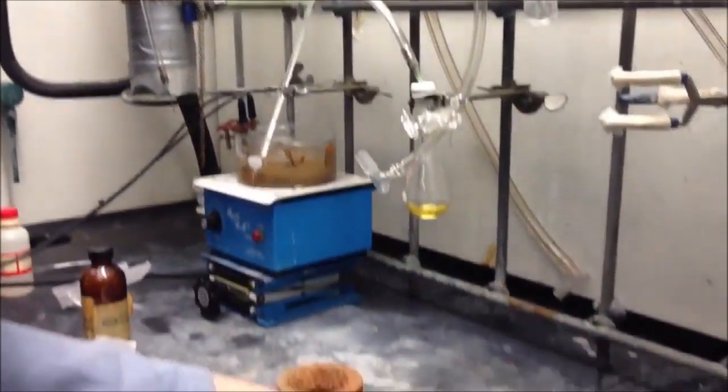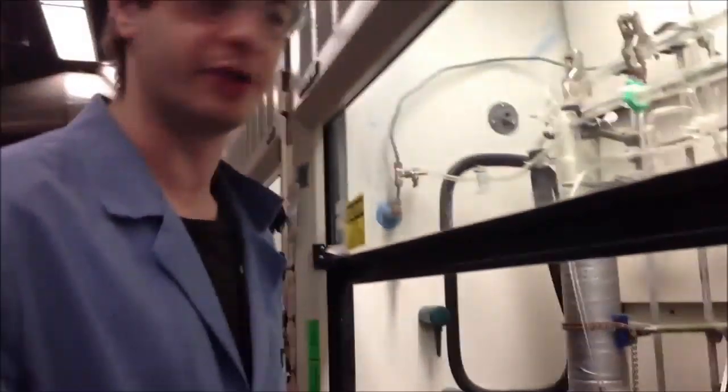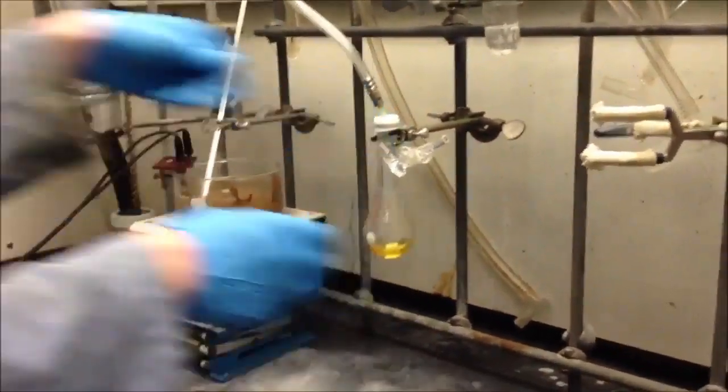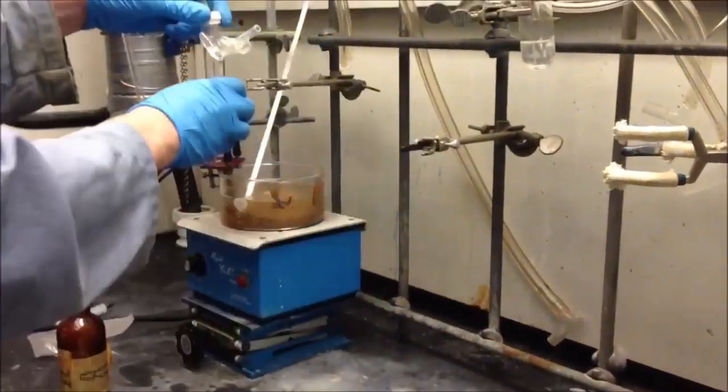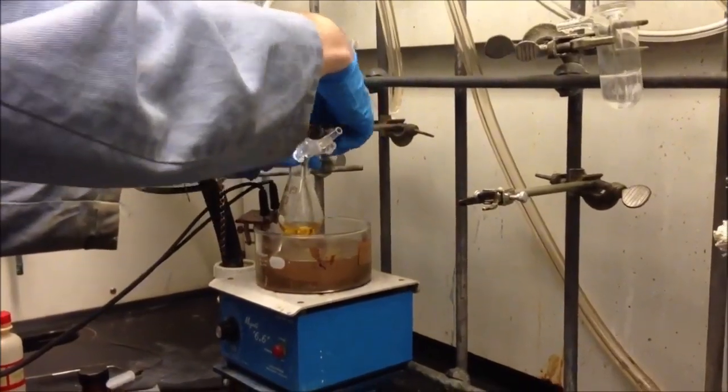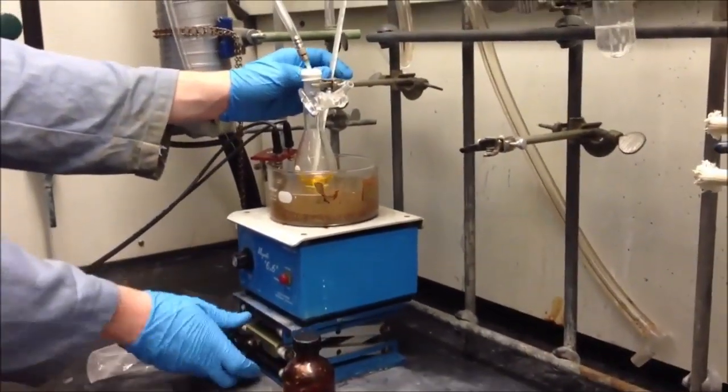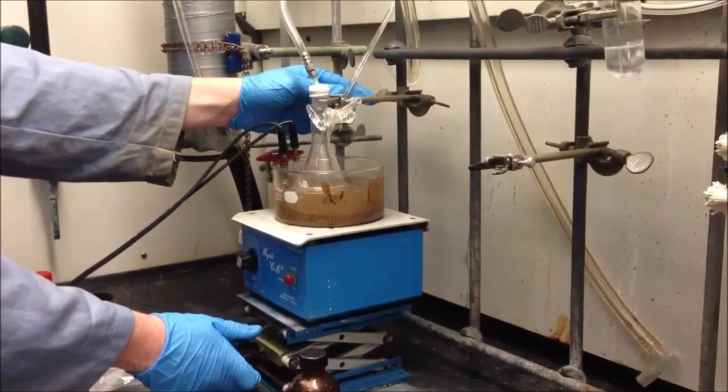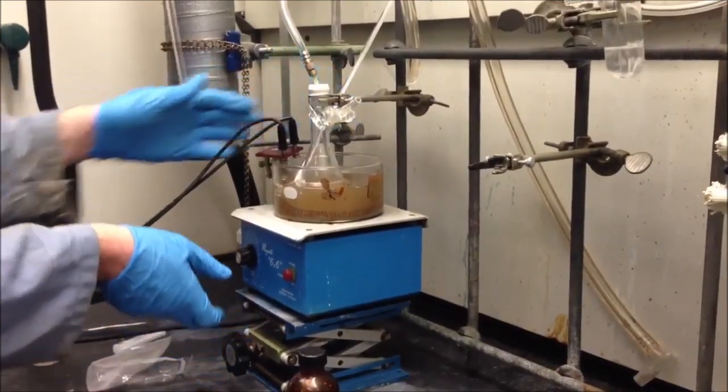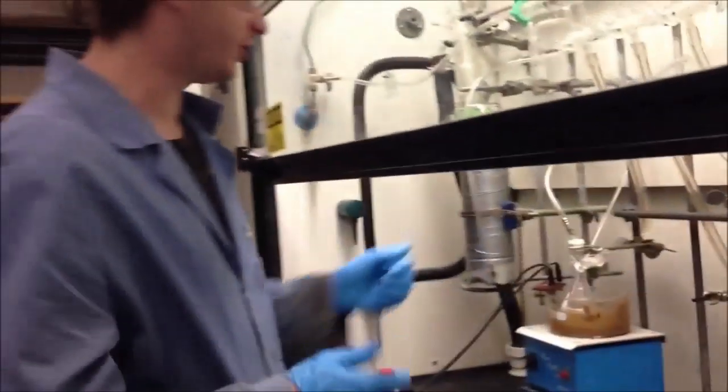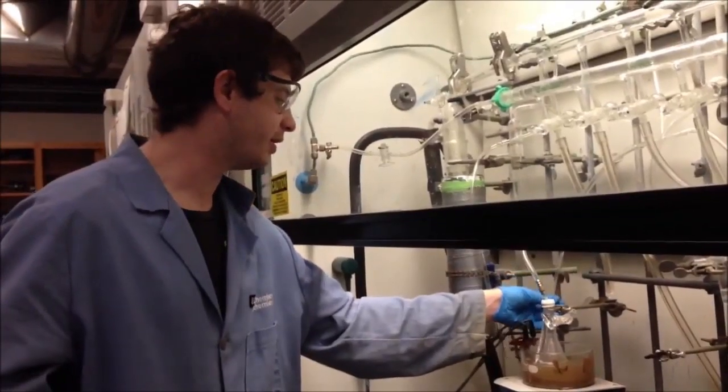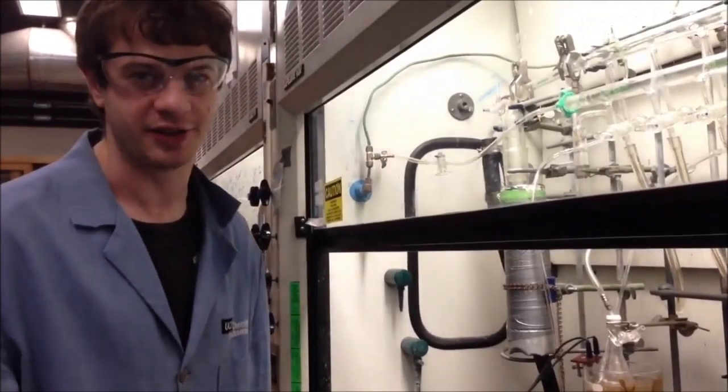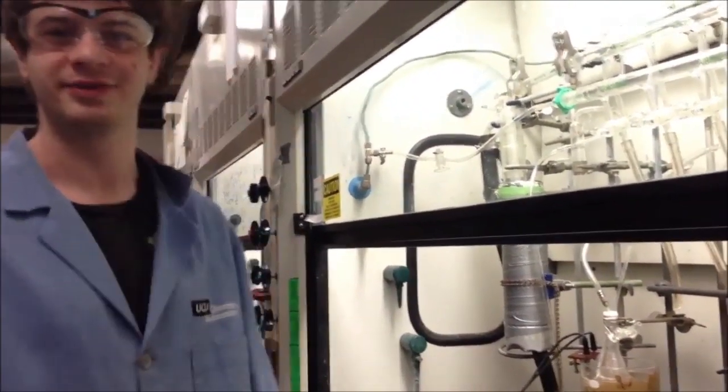Okay, now it's time to heat this bad boy up to 140 degrees. Let's go ahead and take it over here. Okay, now in the bath and stirring, but the temperature is a little too low, so I'm going to go ahead and adjust that to get it to 140. But we'll check back in five hours, because that's how long this reaction takes, and see what we've got. Alright.